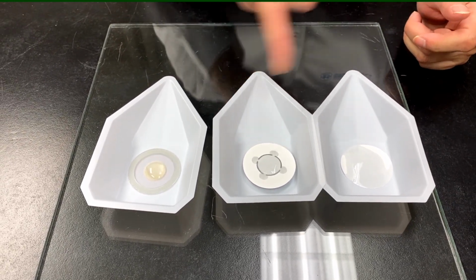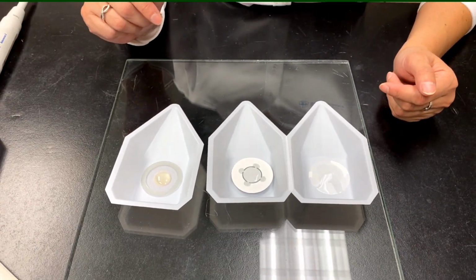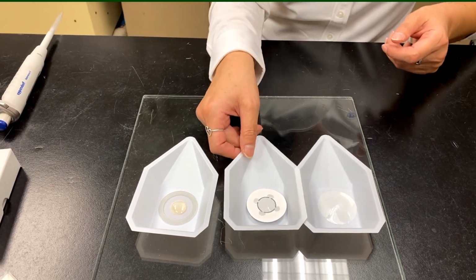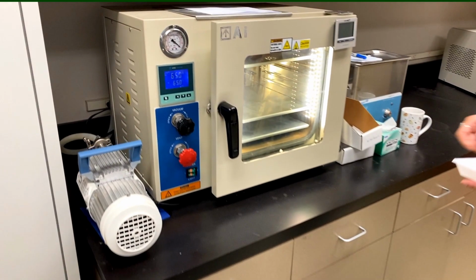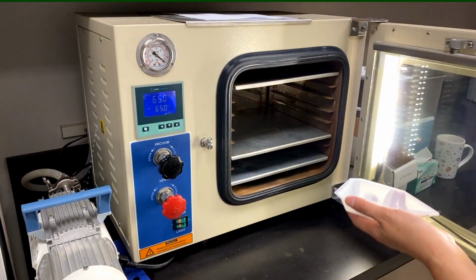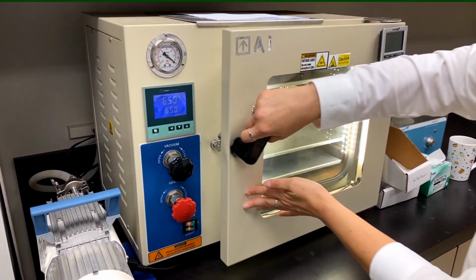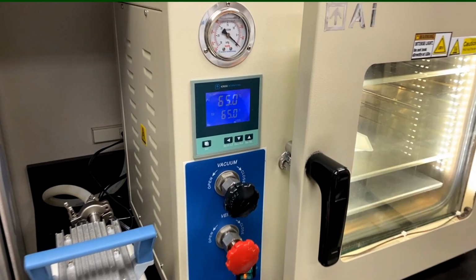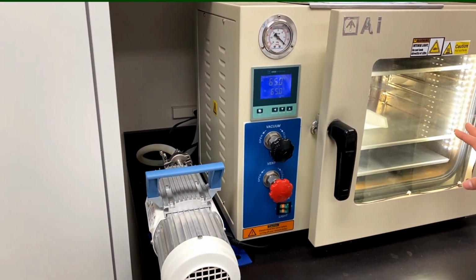Right. So once I've pipetted all my samples on here, you would just stick this in a vacuum oven or an oven, and we can just dry it down. Let me take one over now so you can see what we're using here. These should go fairly quickly, only a couple of minutes. So here I have this vacuum oven. We would usually put this around 60 to 70 degrees for a couple of minutes. That should dry very quickly because I only have around 200 microliters in there.